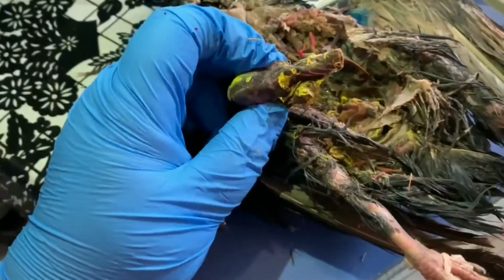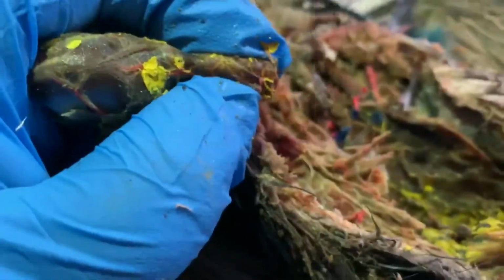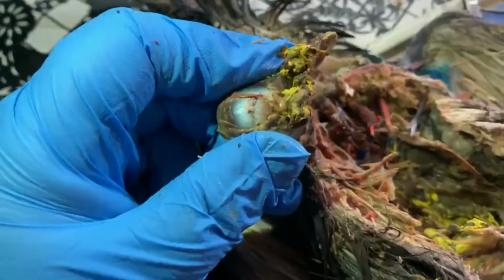All right, looking at Eric's bird, just to rehash the digestive system, Eric's bird has a really nice esophagus that was evident there. The esophagus opens up into this, the stomach. The stomach is more tubular, and then at the base of the stomach we have our rock solid gizzard. The gizzard is what's filled with rocks and helps aid in digestion.